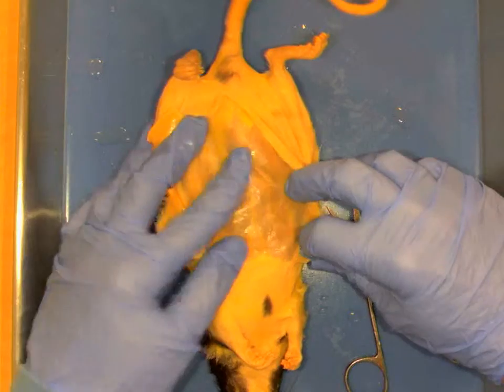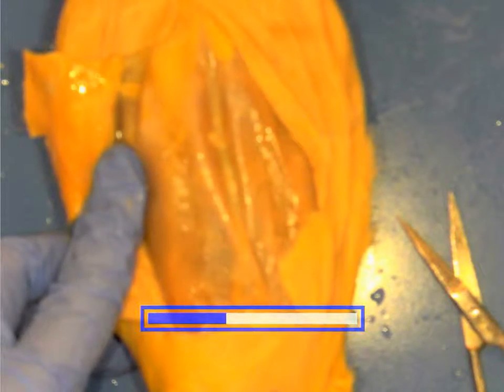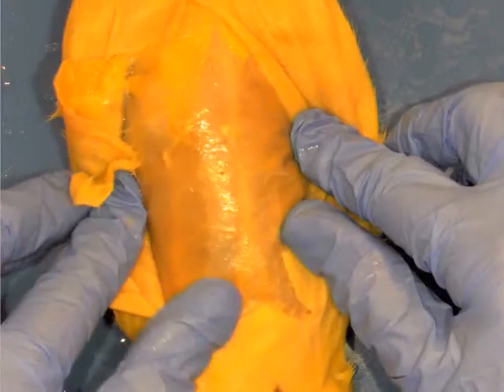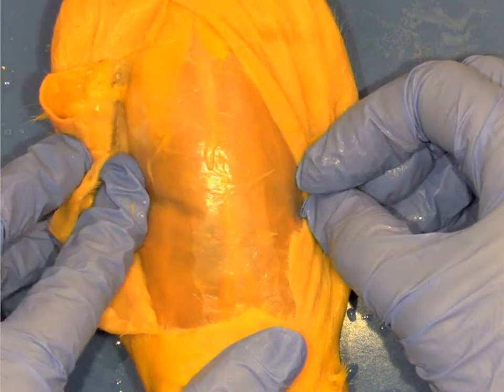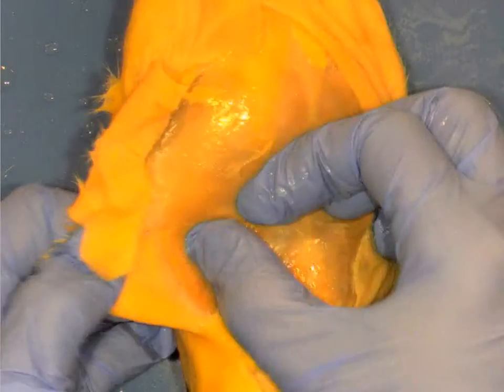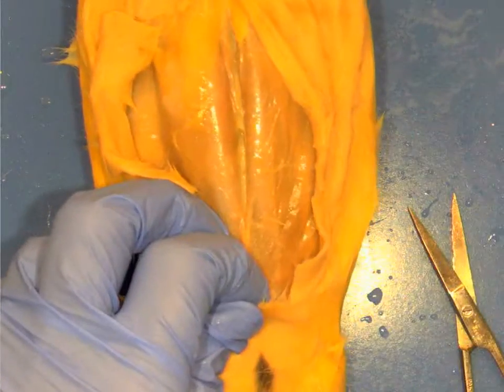Now let me pause a moment and zoom down on this rat. Just let it focus. So I think that you probably can see that line that's running down the center. On either side of that line is the rectus abdominis. That's one of the muscles of the abdominal cavity. I'm not sure if you can see over here to the side, there's some muscle groups that are called the external obliques. Let me pause this just for a moment.